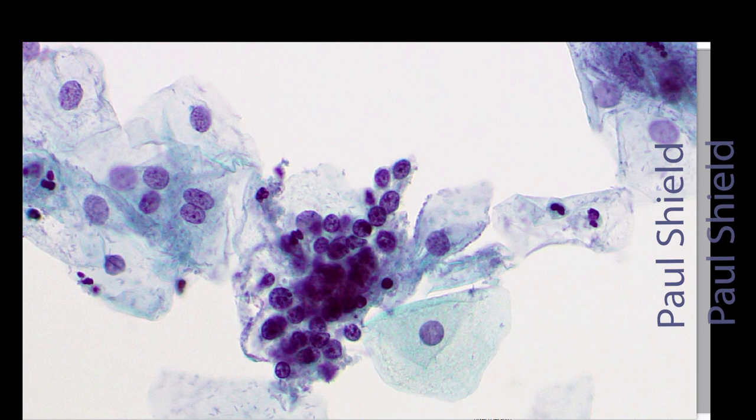If I look carefully at them, I really can't see any that have a squamous, well-defined border to the cytoplasm. Notice also, in comparison to the intermediate nuclei around, these are really quite small cells. They're all quite round, but they're showing variation in size, and that's because they're lymphocytes of varying maturity.